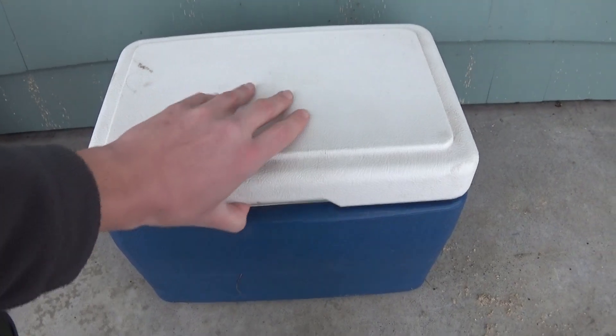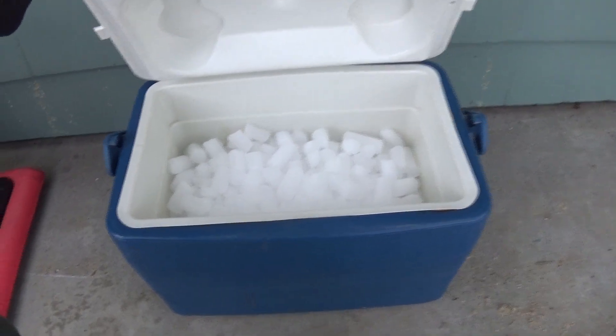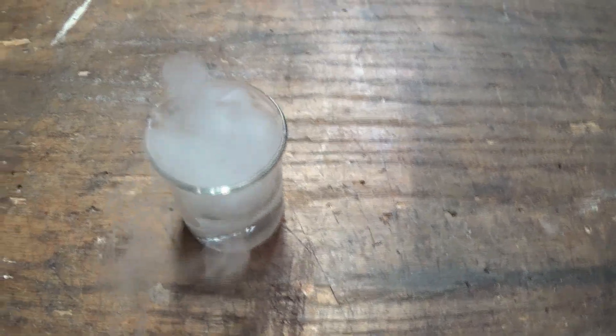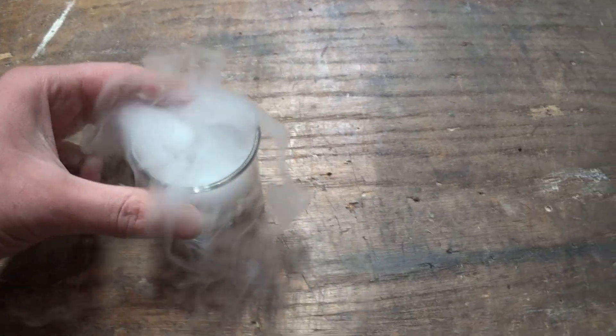The first thing I needed to get was some dry ice. Unfortunately, the minimum order was 10 pounds. So a bunch of it ended up getting wasted, but it's still pretty fun to put it in water.